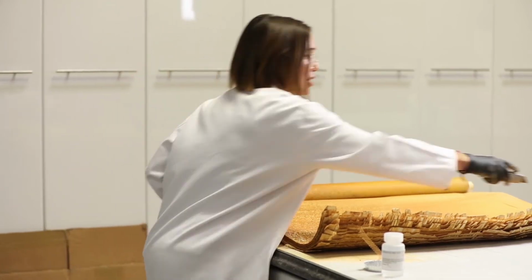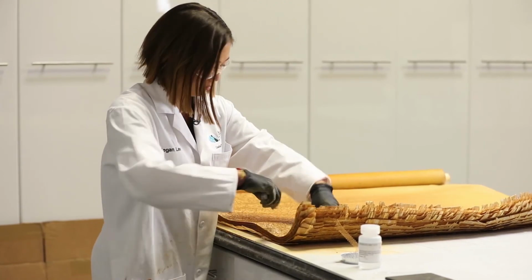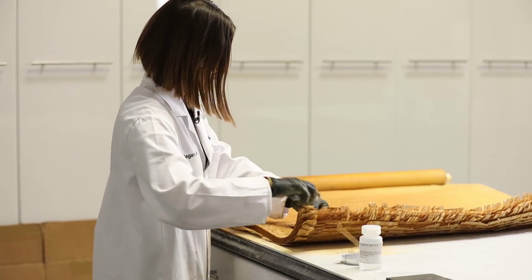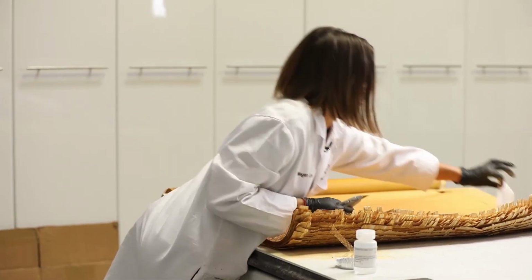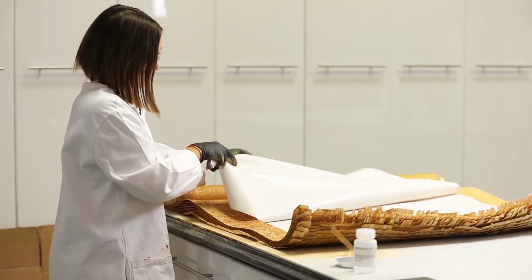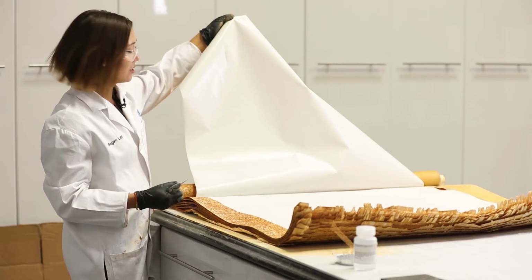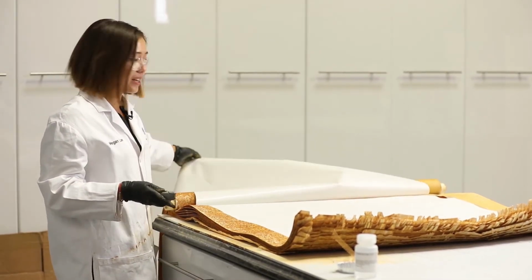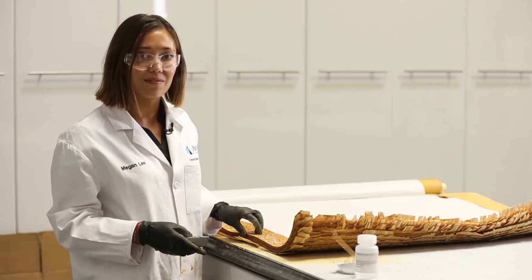We do this by cutting open a membrane leaf and looking at the membrane backing to see if we can find any obvious signs of contamination. We'll see that it is white in color and we don't see any obvious foulant material within the membrane leaf.